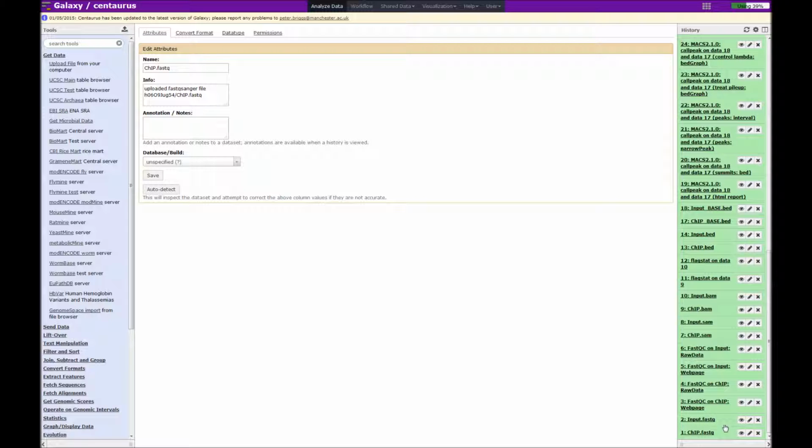So here we are, this is the beginning of our Galaxy history and the history panel, and we have a ChIP fastQ file, which is the reads that are enriched for our transcription factor binding sites, and an input, which is the reads that have gone through the chromatin immunoprecipitation protocol but have not been enriched with the specific antibody. So this acts as a background control that we can use to compare against our ChIP sequences.